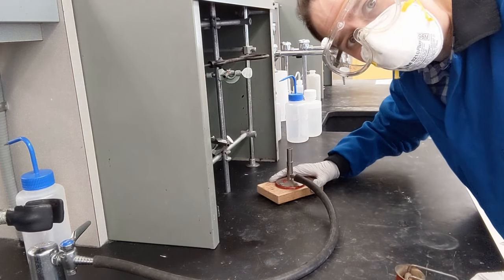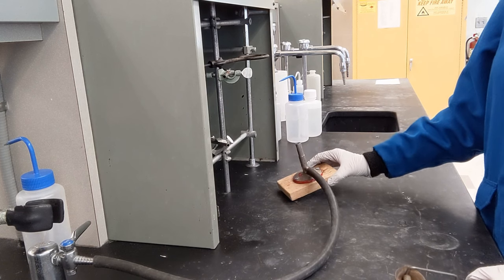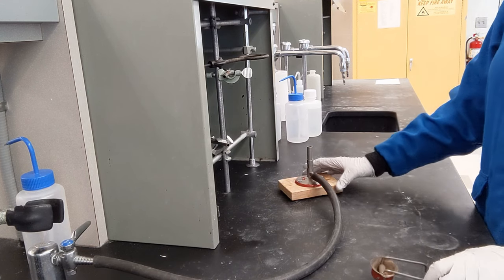This is how to use a Bunsen burner. This is a Bunsen burner used for controlled flame. There are a few other parts that go with it.